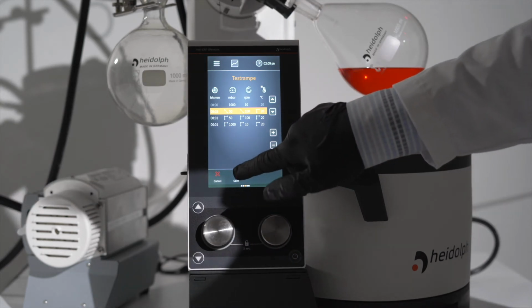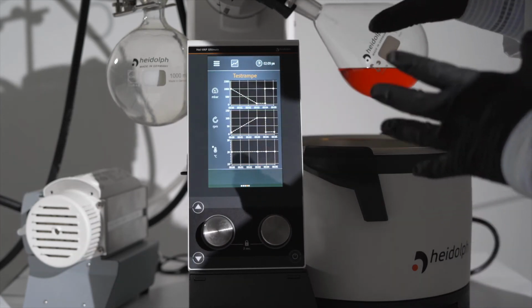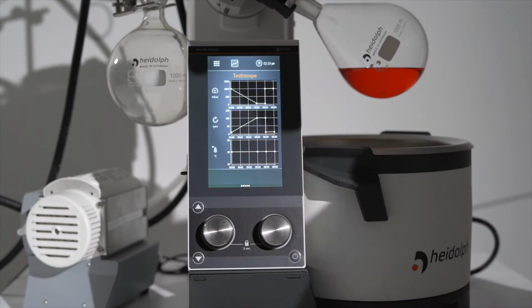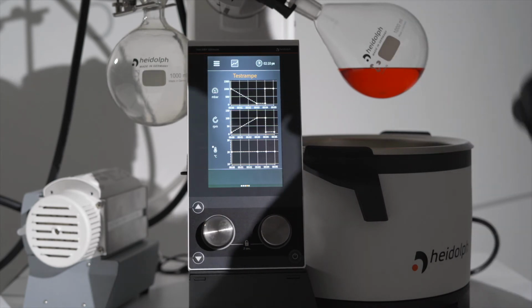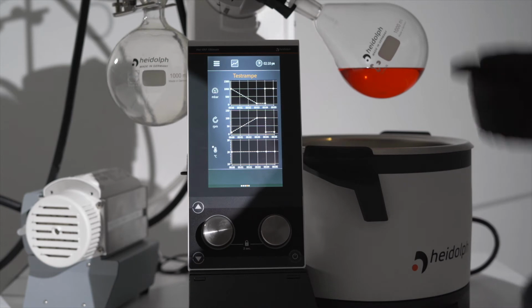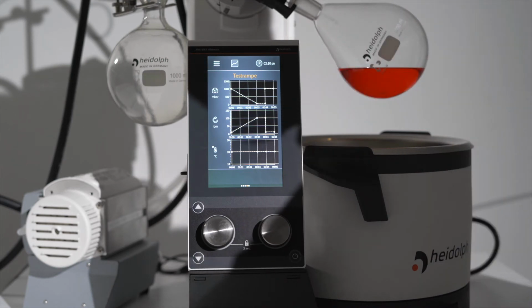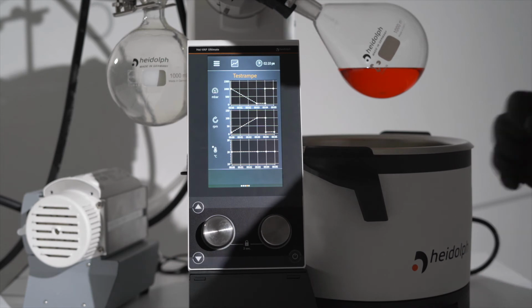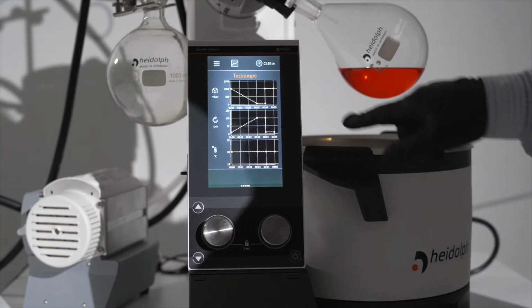Afterwards, you would just save your profile, and then if you scroll once more to the right, you will see a graph of what will actually be happening over time during your process. While your evaporation process is actually running, you'll see an orange line that will give your actual conditions inside your evaporation flask. That way you can double check whether or not your actual are meeting your ideal conditions.